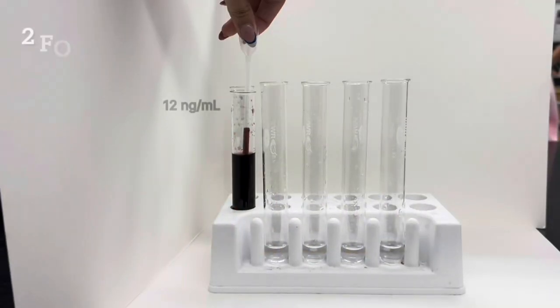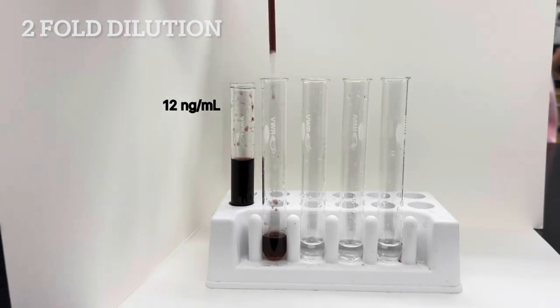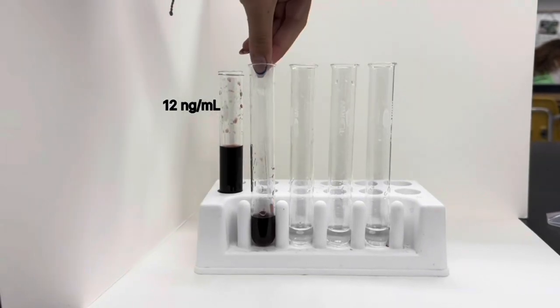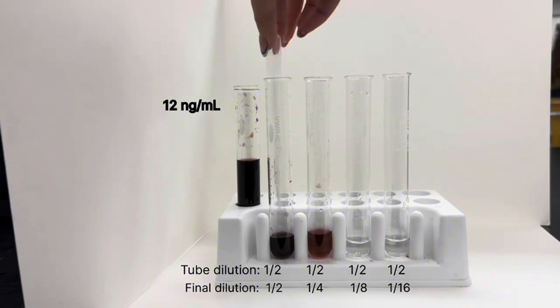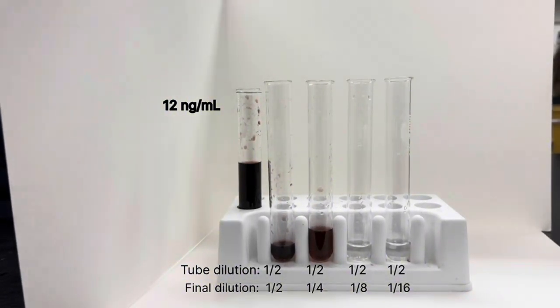Now we will perform a twofold serial dilution. The original stock solution is a concentration of 12 nanograms per milliliter, and we will add 2 milliliters of it into a tube with 2 milliliters of diluent. This will create a 2:4 ratio of solution to diluent, which is equivalent to a tube dilution of 1/2 for all of the tubes going forward.